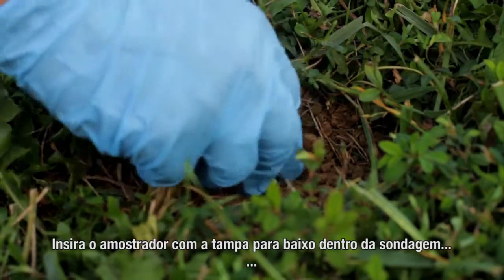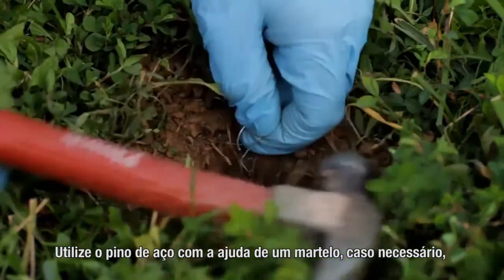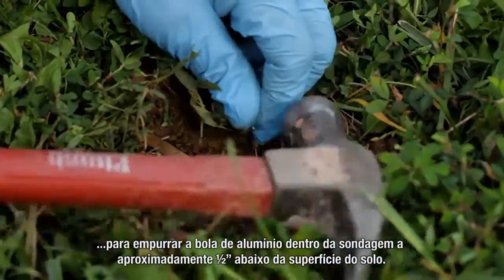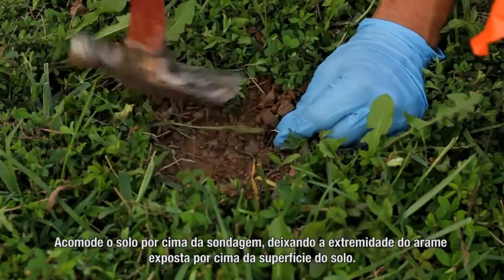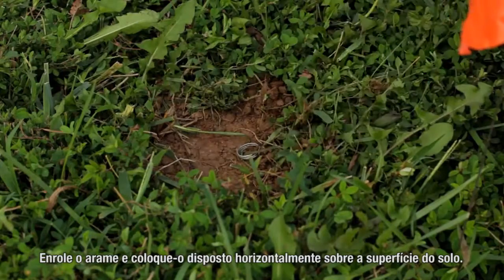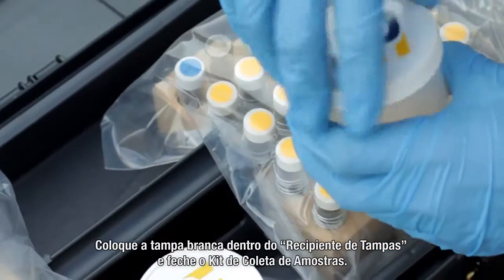Lower the sampler, open end down, into the hole and compress the ball into the top of the hole to tightly plug it. Use a provided tapping dowel and a hammer if necessary to push or tap the foil ball into the hole so it rests approximately one half inch below the ground surface. Collapse the soils above the plug, leaving the end of the wire exposed above the surface of the ground. Coil the wire and lay it flat on the ground surface. Place the solid cap in the cap storage container and close the sample collection kit.